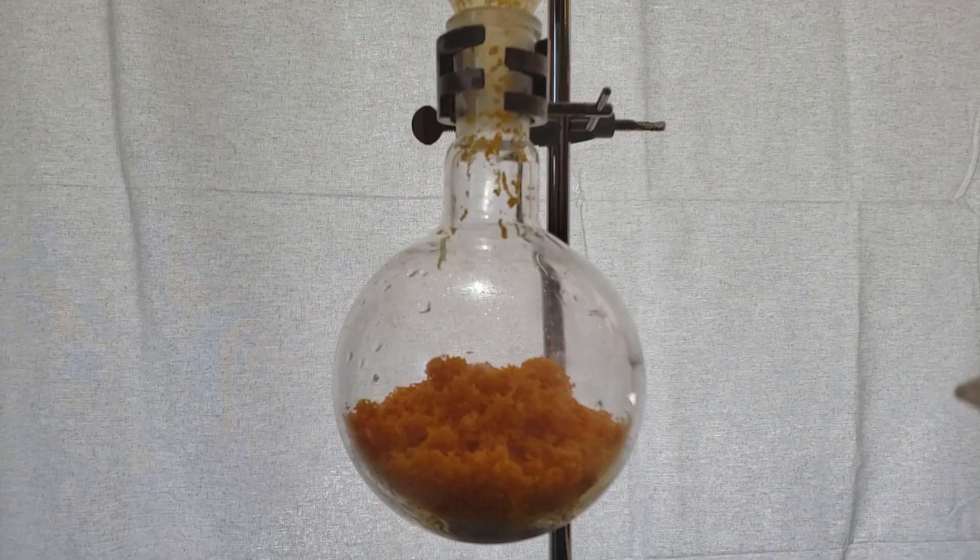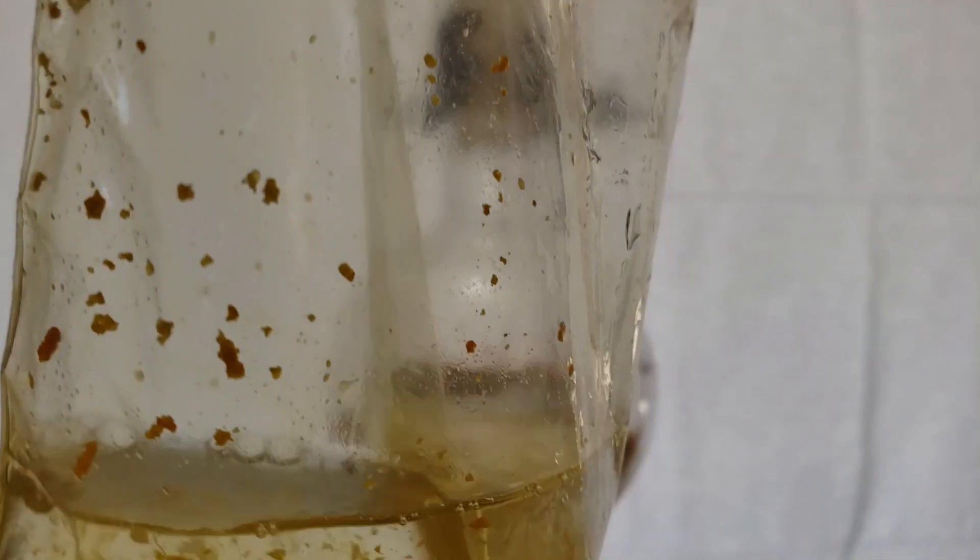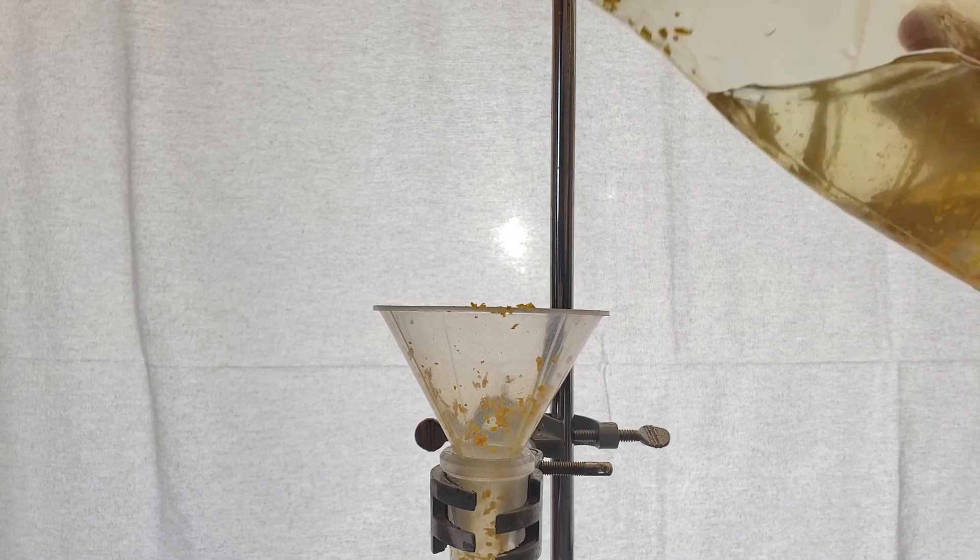I rinsed the bag out with about 100ml of distilled water, and I also rinsed the sides of the flask off with more distilled water as well.